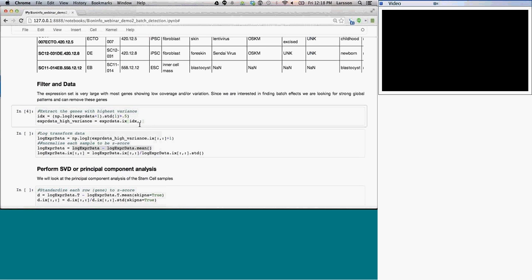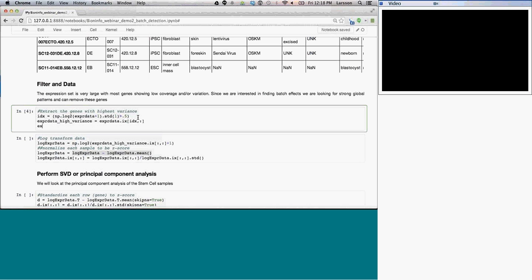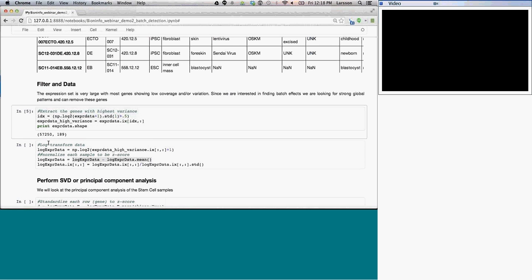And at the end of here, we can actually look at the expression data, print the shape, which is the size of it, and we can see that it was 57,250, and it actually changes to expression data, high variance, and reduced to 12,700 genes by 189 different ones.